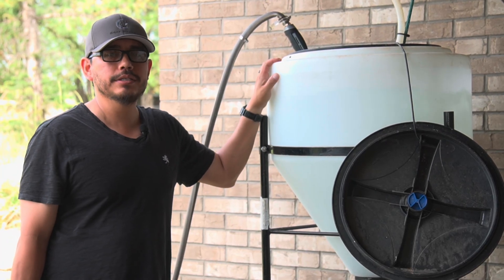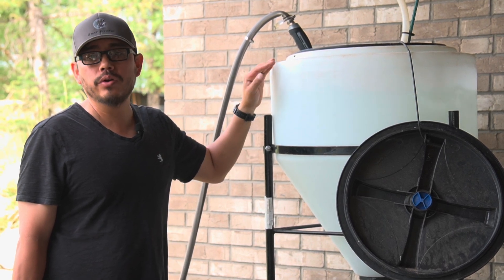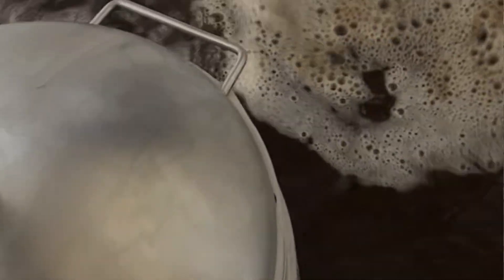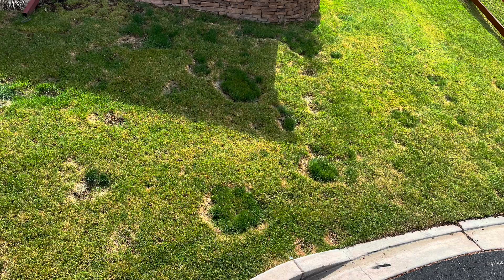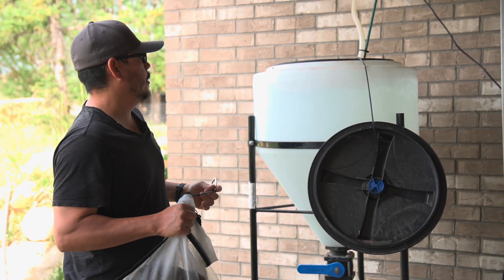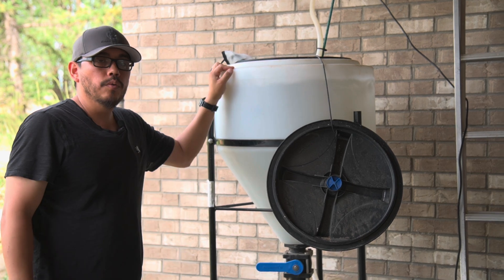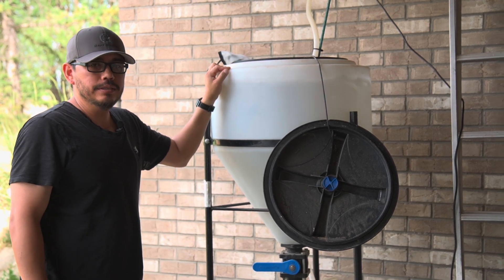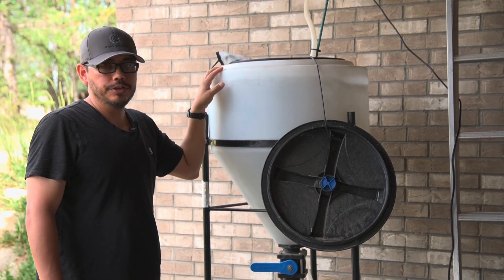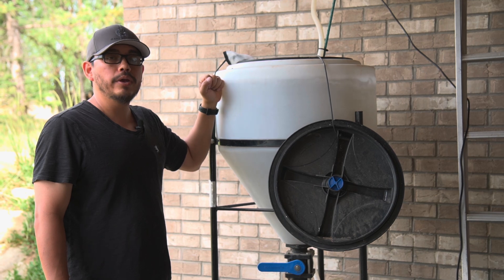You can do this in small applications like a five-gallon bucket, a 30-gallon tank like we have here, or a 250-gallon batch to remediate soil having an issue with ring fungus. Now that our tank is full, we're going to drop our bag in and attach it. We'll run this for about 10 to 15 minutes to get all the microbes off the material in large enough numbers, then we'll take our sample and look at it under the microscope.